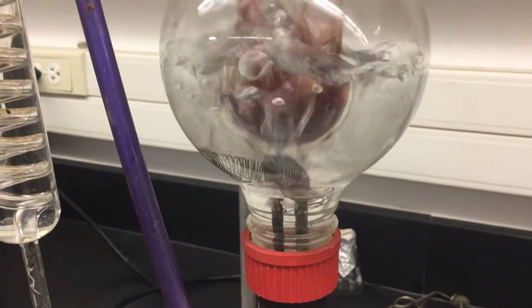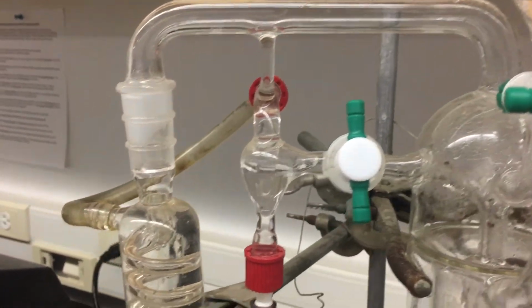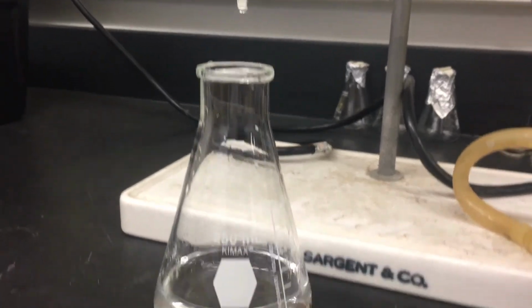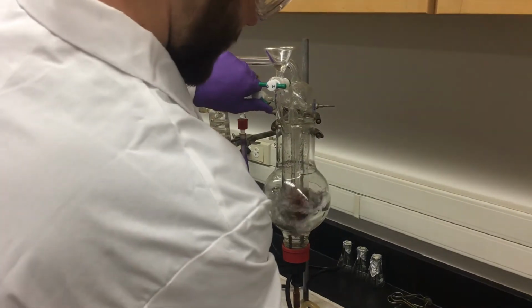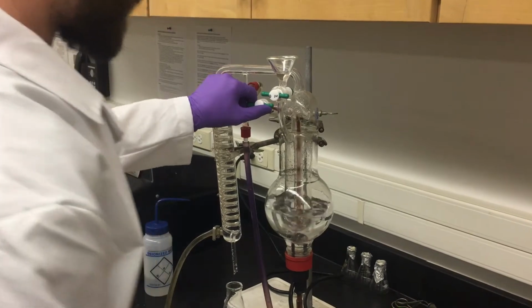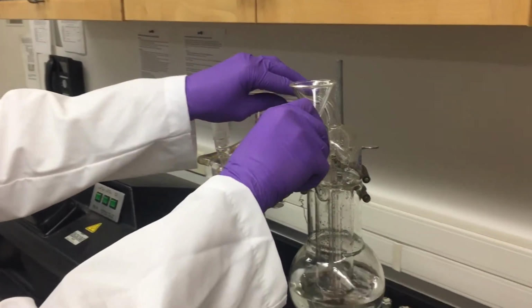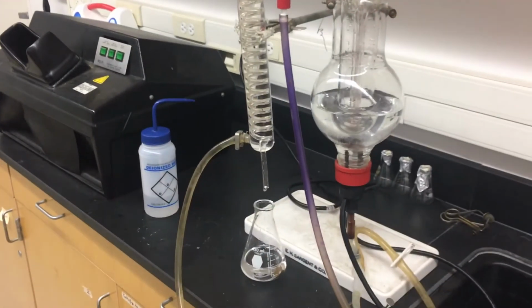As the water in the boil chamber boils, it passes steam through the sample. This is carried through the top joint into the condensing column, where it is cooled to a liquid distillate. Once 100 milliliters of distillate has been collected, turn off the heating element and turn the center stopcock parallel, flushing the sample from the sample chamber. To rinse out the remaining sample, turn the right stopcock to the I indication, allowing the water still located in the funnel to rinse the remaining sample.